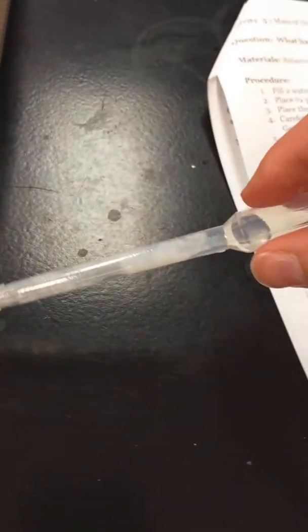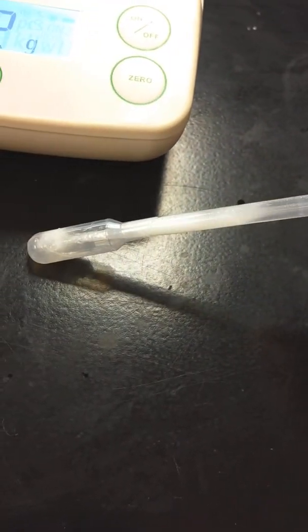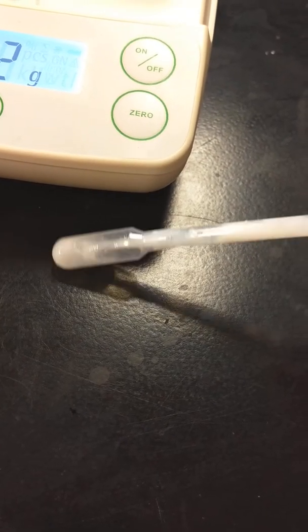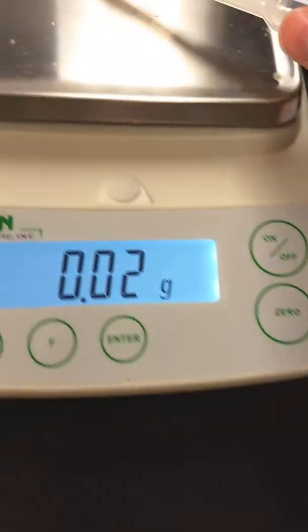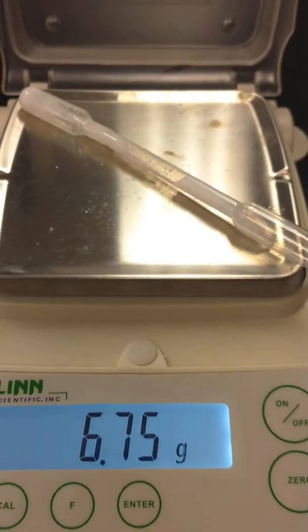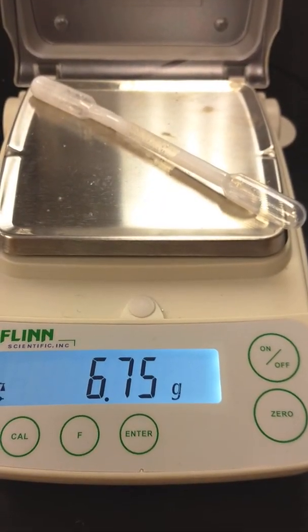You can see that salt was made — there's a white precipitate in there. See the salt? Now that I've reacted them, let's put it right back on the balance and see what I get. Go ahead and record that.